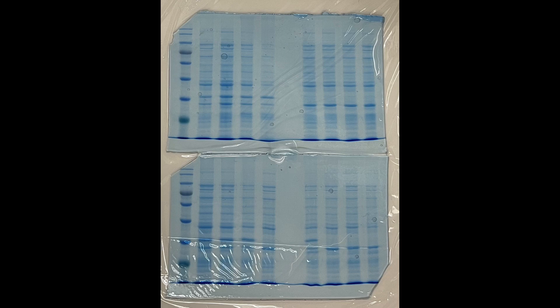SDS-PAGE gels are similar to agarose gels in that we use electricity to move our samples through a solid, porous matrix. But there are many differences in terms of how we handle them, the way we pour them, and even their sturdiness or robustness. There's a lot that can go wrong during this process, so the key to running a really good SDS-PAGE gel and then a follow-up Western is to come prepared and understand what you're doing prior to doing it.